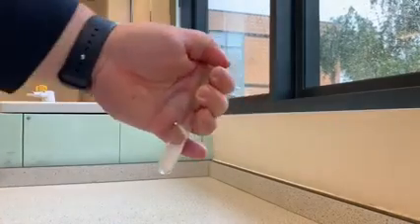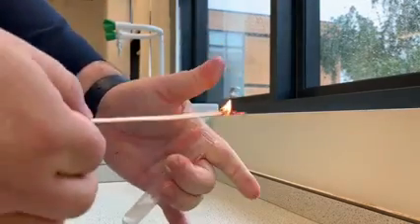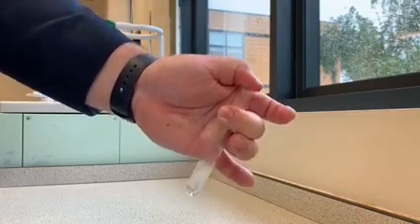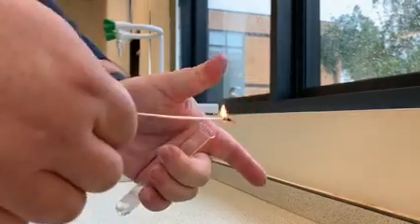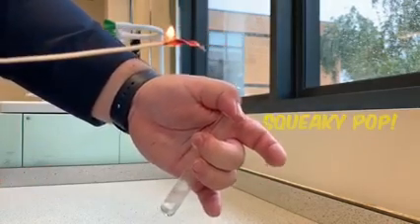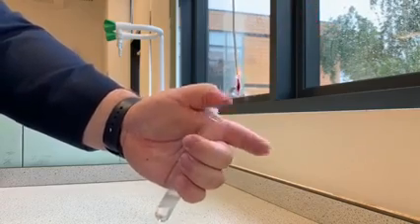So the test for hydrogen gas is when you light the actual gas, it should make a popping sound. More of a squeaky pop sound. Let's listen. There we go.